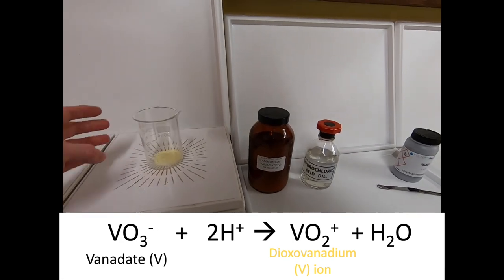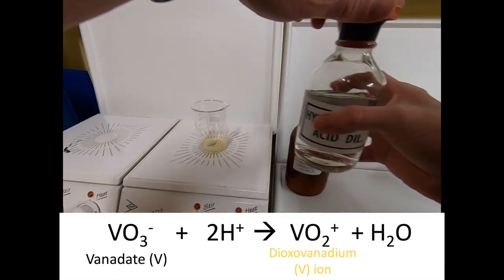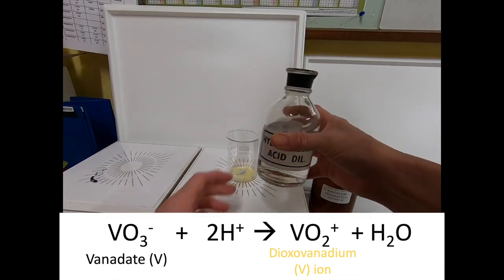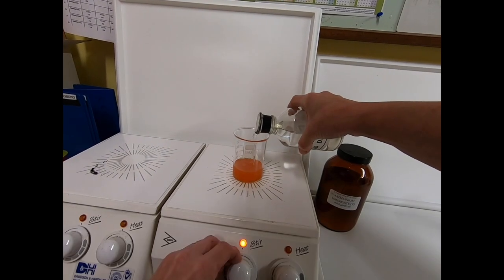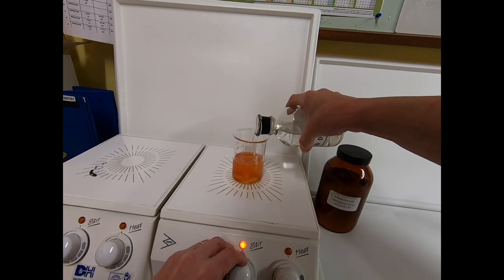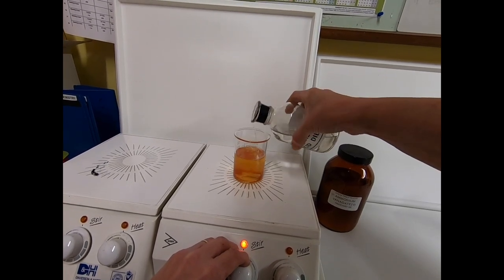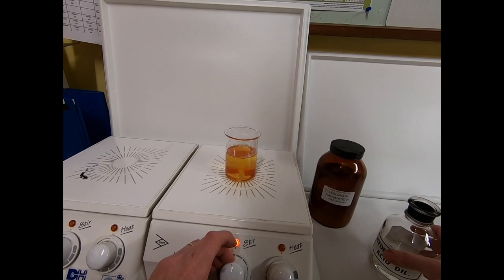The hydrogen ions will also be involved in the reduction reactions. We have to use hydrochloric acid because the chlorine in hydrochloric acid is in its lowest oxidation state, so it cannot be reduced.